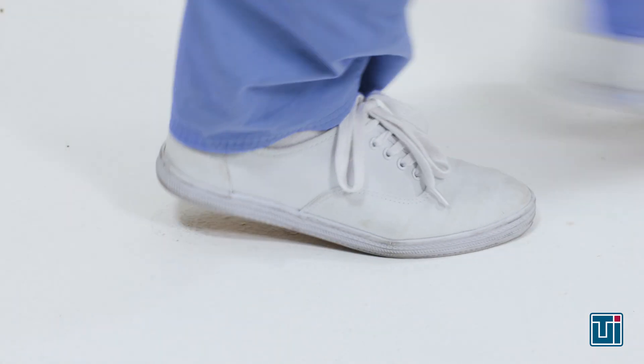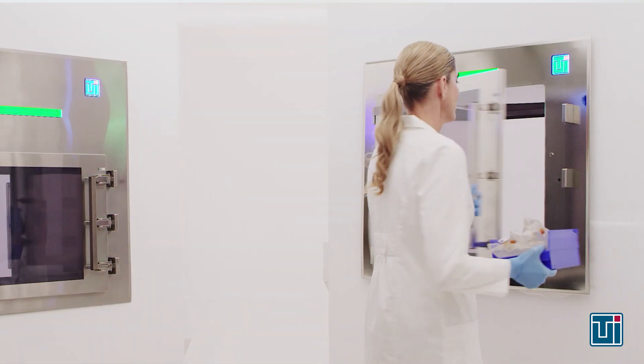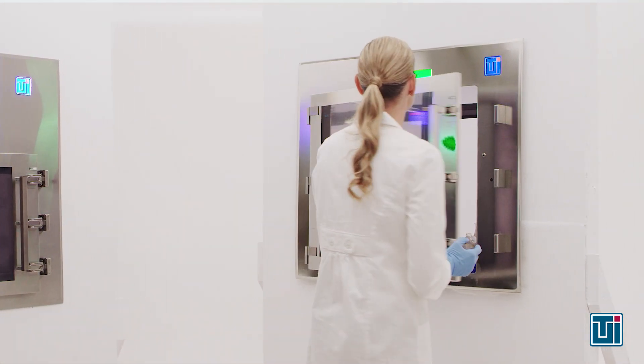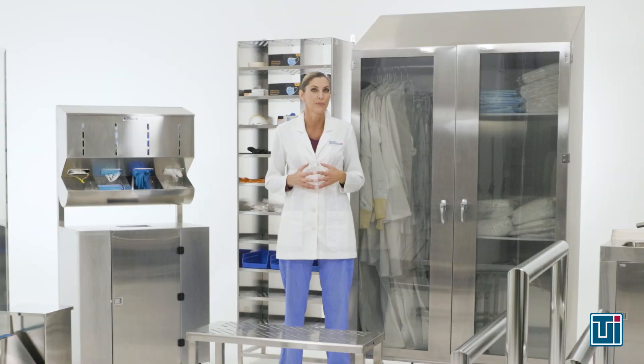Since the clean room staff is the primary source of contamination, reducing foot traffic into the clean room helps to limit particle influx. Utilizing a pass-through chamber for sample or equipment transfer limits the number of people entering and exiting the clean room.